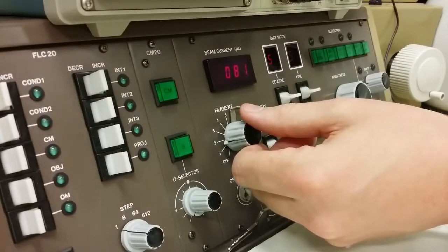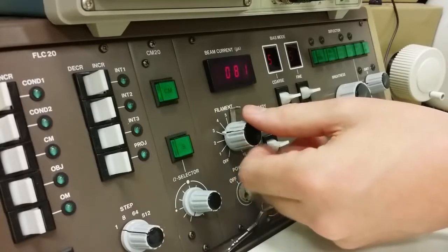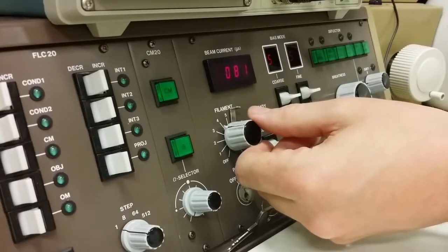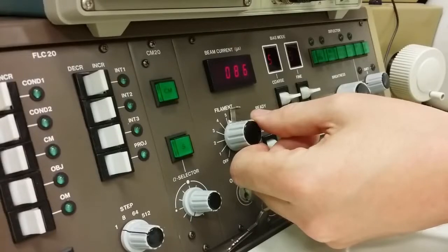The next thing is to turn on the filament. We do that by turning on the filament knob. And here it is important, depending on what kind of source you have for the electron. If it is a basic tungsten filament, then you can turn this knob up all the way with a constant slow motion, half a minute turning. If instead you have a LaB6 crystal filament unit, then you must heat that much more slowly, several minutes. Otherwise, if you heat it up too fast, the crystal might crack in its soldering against the filament wire.